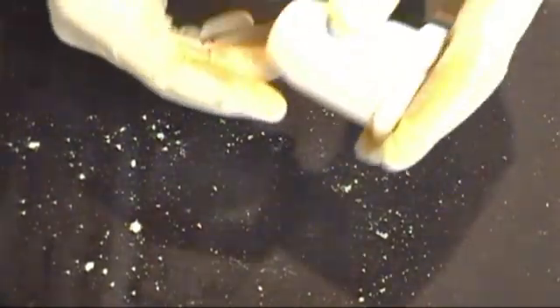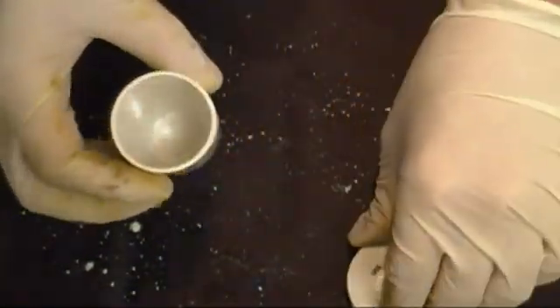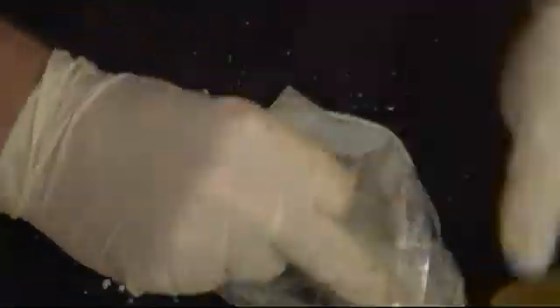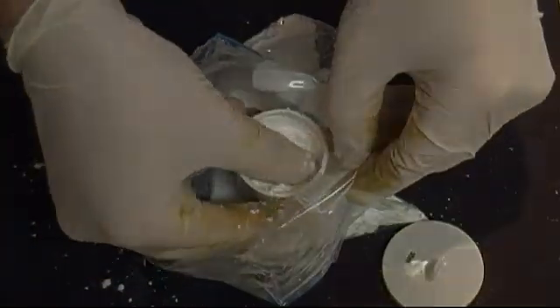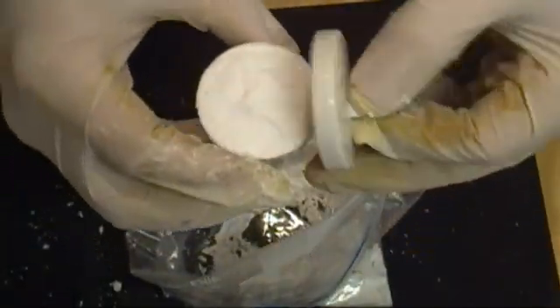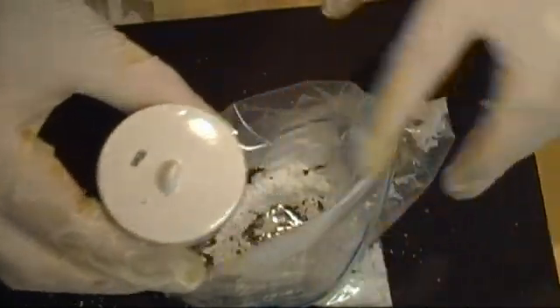For the next method, you'll need a porcelain crucible. Place it in the Ziploc bag and start packing it with the mixture. Use as much pressure as possible to pack it without breaking the crucible. Once you are done, remove the crucible and add a lid. This second method of heating is much more reliable and gives larger amounts of product than the previous. However, it will require one of these — this is a metal forge, and will have no problem getting this small crucible red hot.